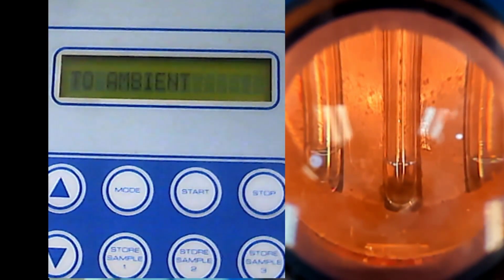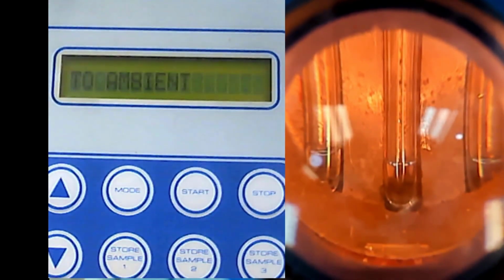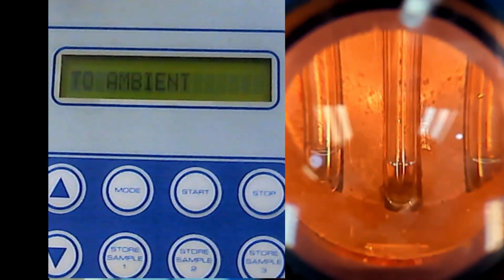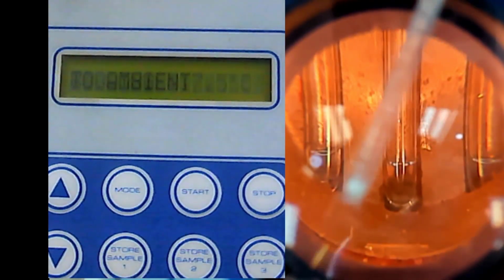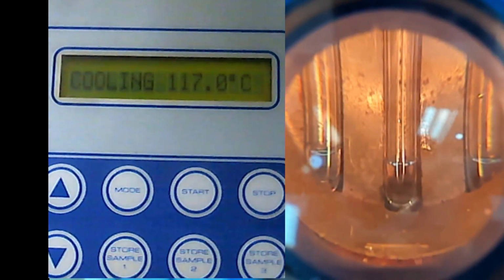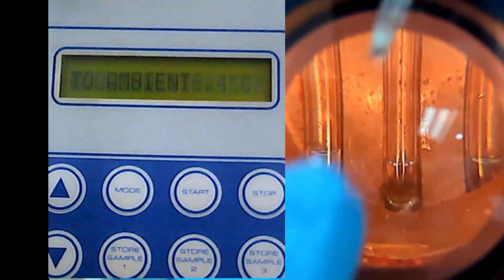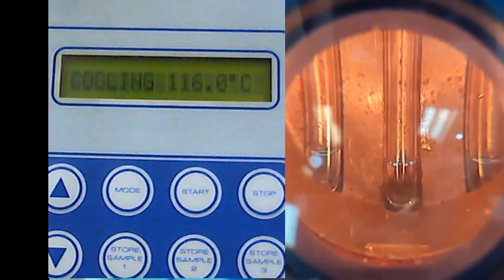One thing about when you melt: let's say you take out the sample from the one we did early on, the unknown that melted early. If you see, it has already become solid again. You cannot use this to check the melting point again, because maybe when it melted at the beginning when we tested our unknown, it already underwent chemical change or decomposition.